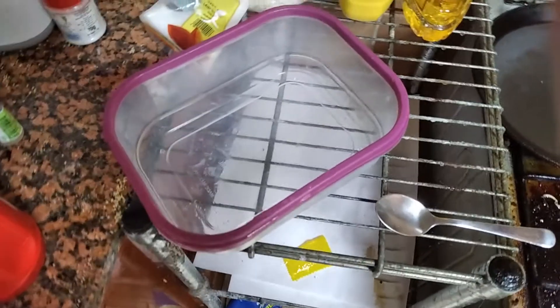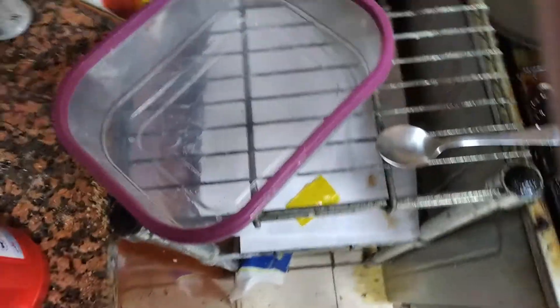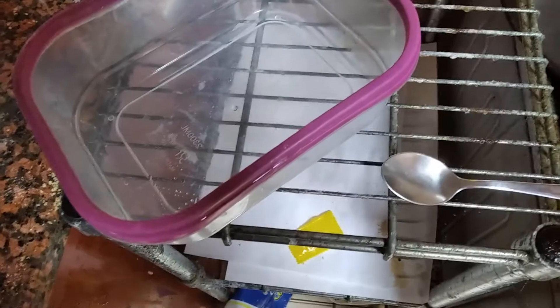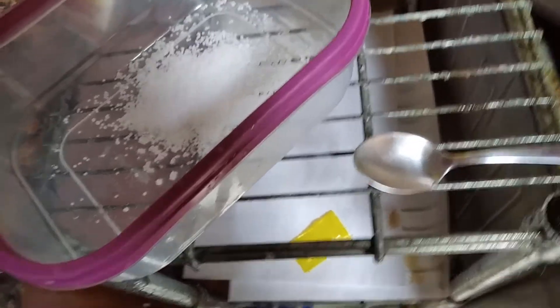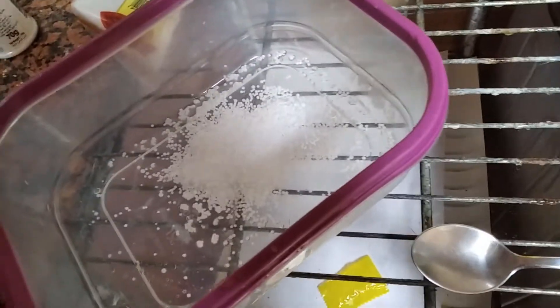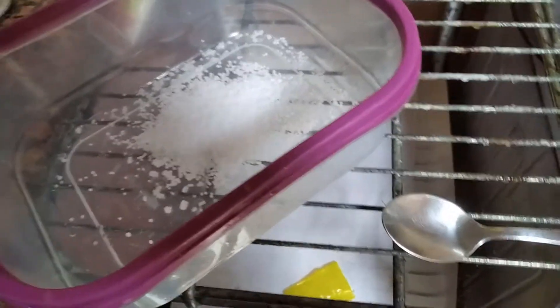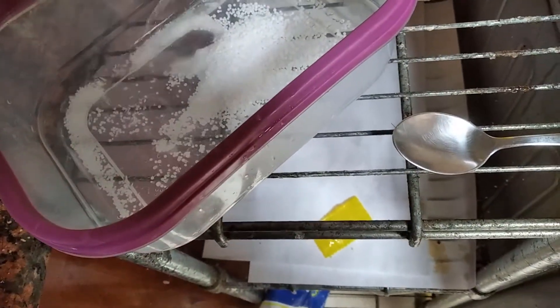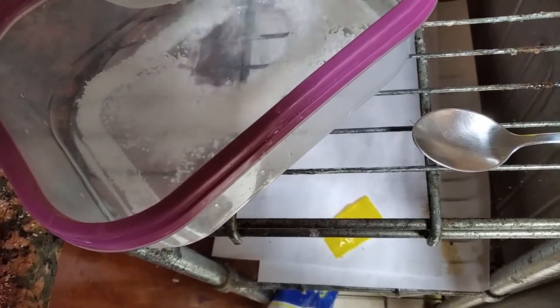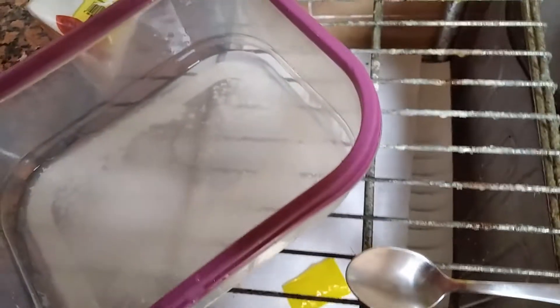Next, we're preparing the curing solution. You need sodium hydroxide for this. You can either buy it or make it. You need a highly concentrated solution of sodium hydroxide — just pour however much you want. It's a curing bath so you don't need any exact amount. You just need it to be deep enough for curing.